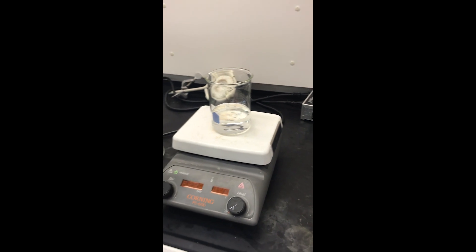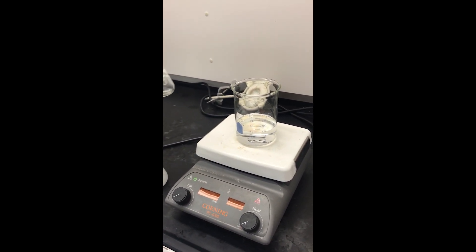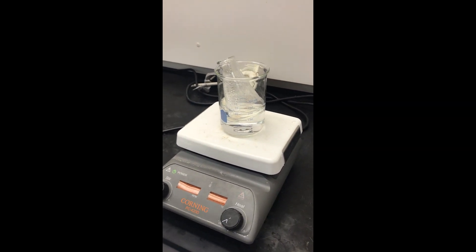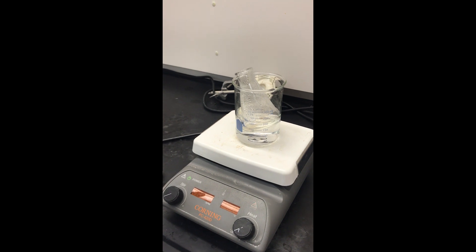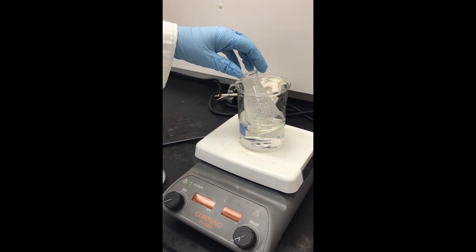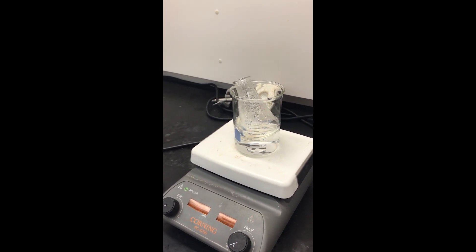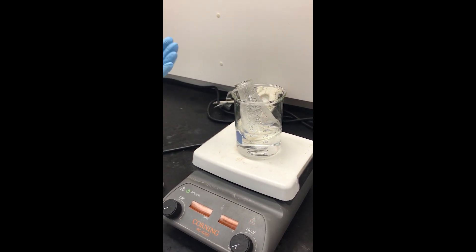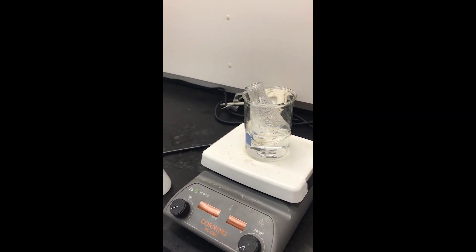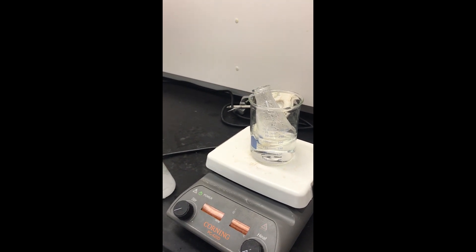So I would heat up this water bath, and then I would have my flask full of the solvent I was going to use, and I would just place that in here so that the water more slowly heats the solvent. This will prevent the solvent from getting overheated, potentially bumping, and that would be very dangerous if it was flammable, because those vapors could condense, hit the hot plate, and if it's extremely flammable, I've seen fires start that way.